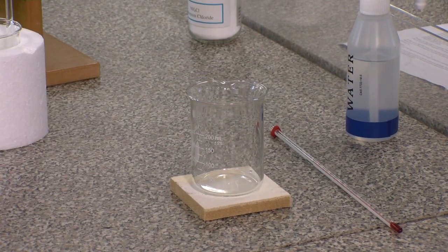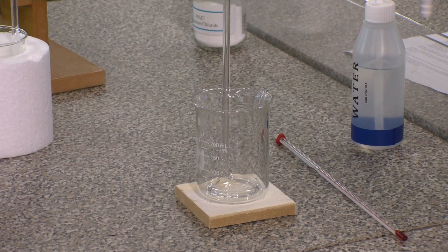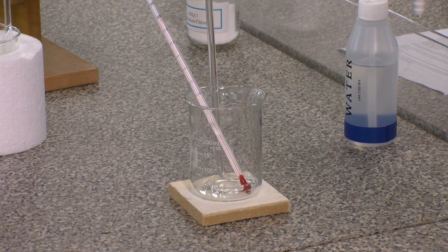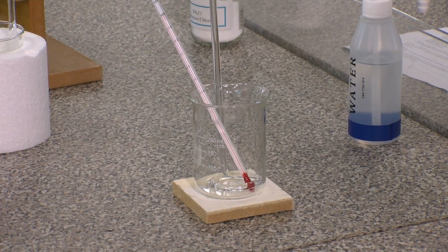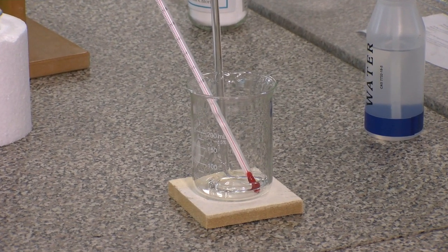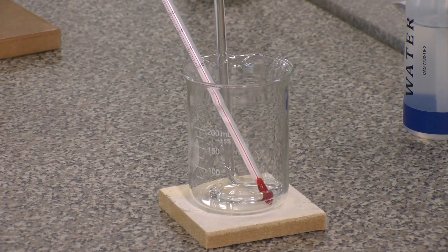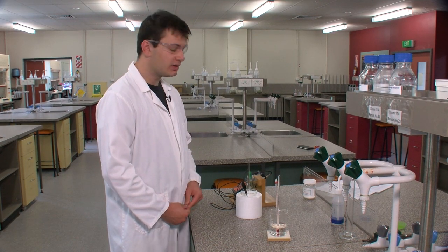Take the other stirrer and place it inside the beaker. Take the thermometer and place that inside the beaker too. Next, using a measuring cylinder, go to the hot water tap and measure out hot water from the tap. Make sure it is actually hot. You'll be working in pairs, so one of you will work with each solution.